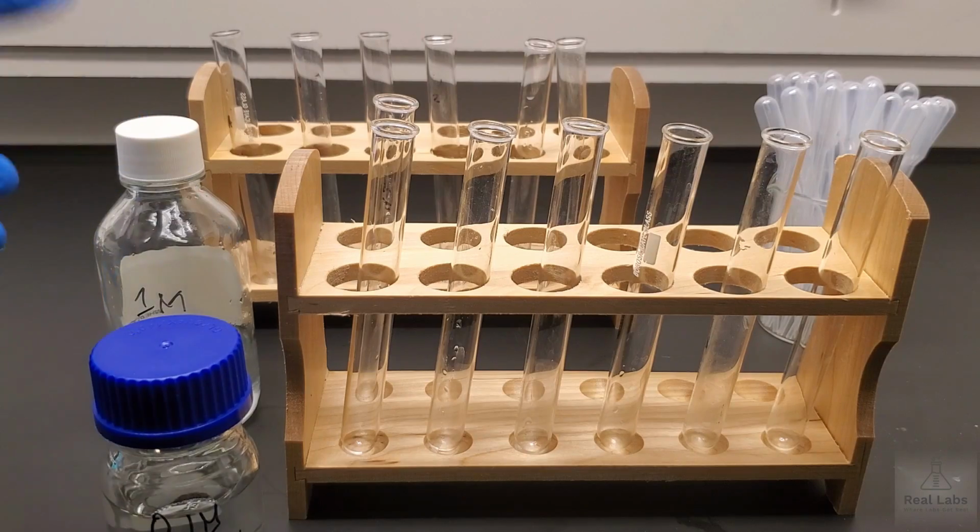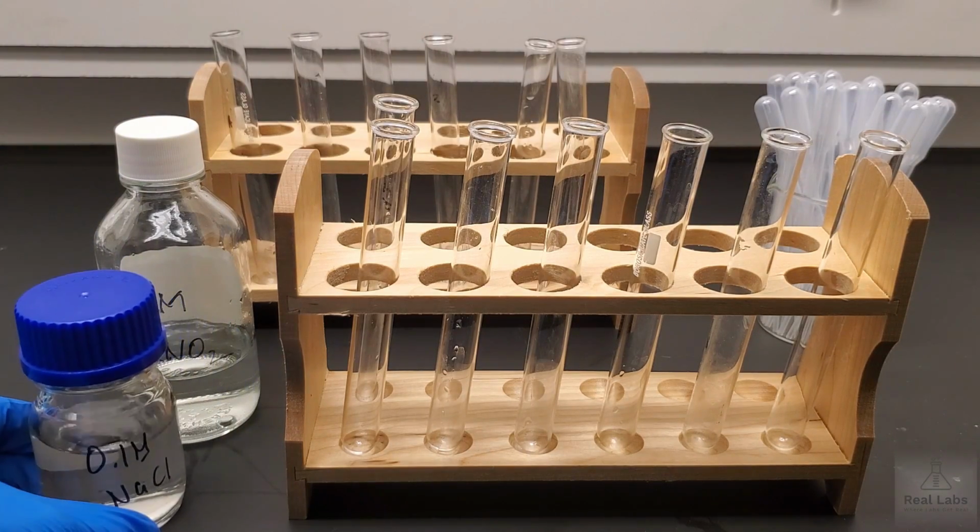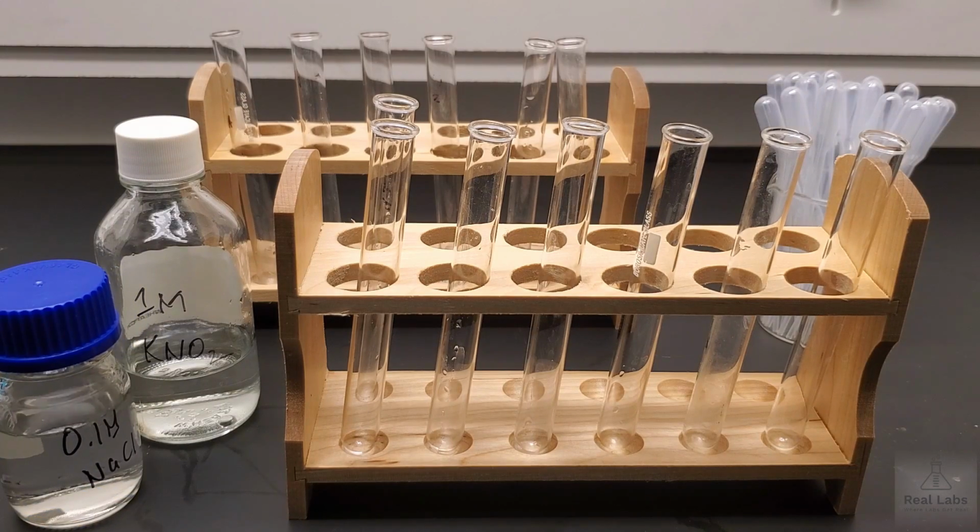And of course I'm wearing gloves simply because we're going to be using a lot of different chemicals today, and so I want to make sure that I am safe. Even though some of these are fairly benign, like sodium chloride solution, of course, we want to be careful when we get to things like iron nitrate systems that are toxic. And so you should definitely look through the list of reactants before you start any reaction and make sure that you are in fact going to do this safely.